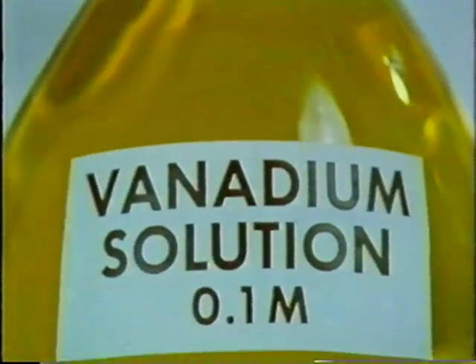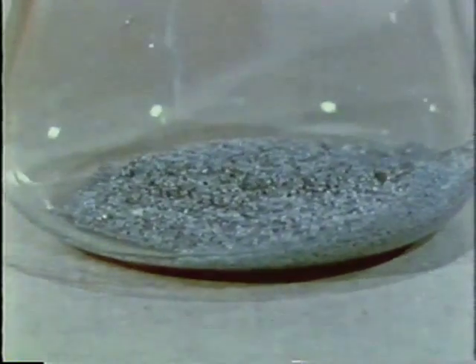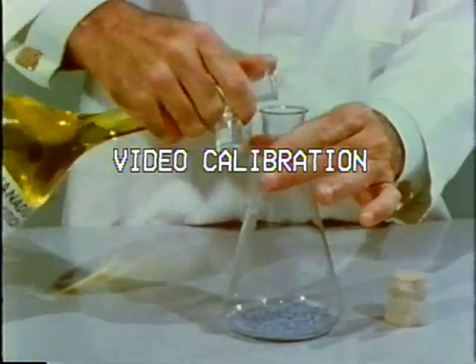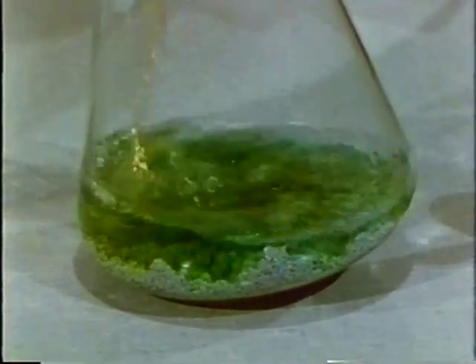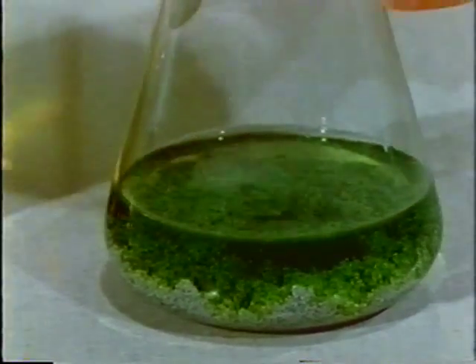Here is a standard solution of 5+ vanadium. Let's try to reduce it to other oxidation states. Zinc is a good reducing agent. The zinc in this flask has been shaken with a small amount of mercury to form an amalgam. A color change occurs in the vanadium solution as soon as it contacts the amalgam. The amalgam provides a large, clean surface for the reaction and minimizes the evolution of hydrogen gas. Shaking the flask increases the area of contact between the zinc and the vanadium solution.